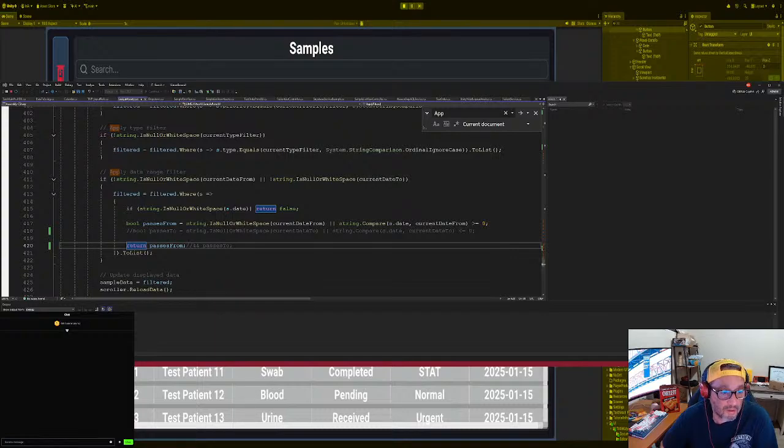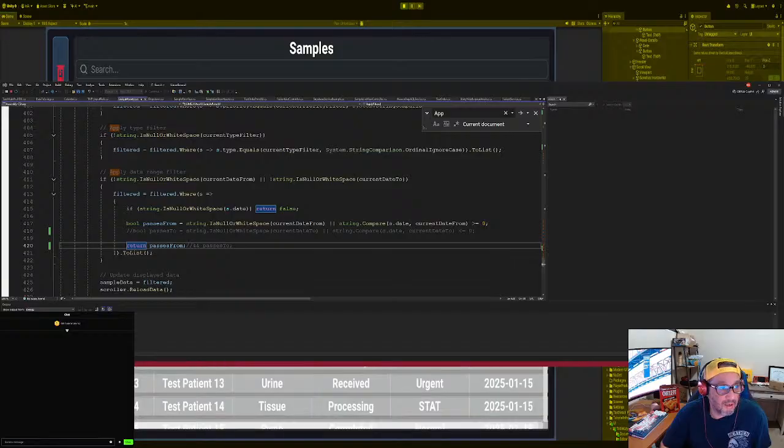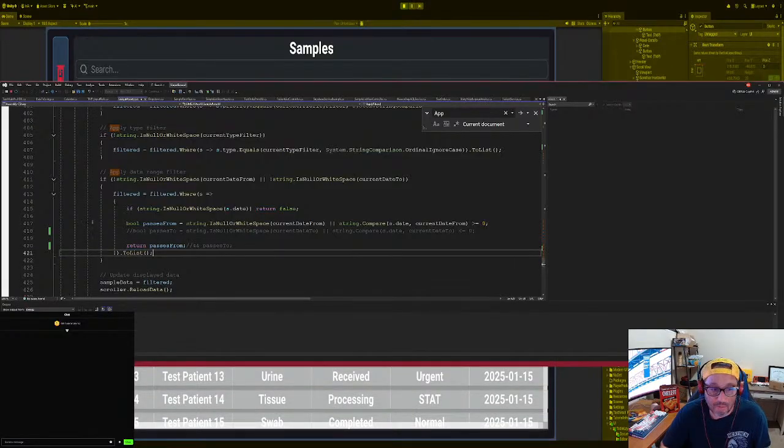2025. That's one, which is good. Two, three, 4, 5. You shouldn't show me any of these. This is okay. But anything afterwards, no. Well, maybe it's because it's 2. No, that's totally wrong. You shouldn't show anything here. All right, all right, all right. Well, anyway, this is how we're gonna set the date and time. Everything else is working. We still got to figure out the date and time.